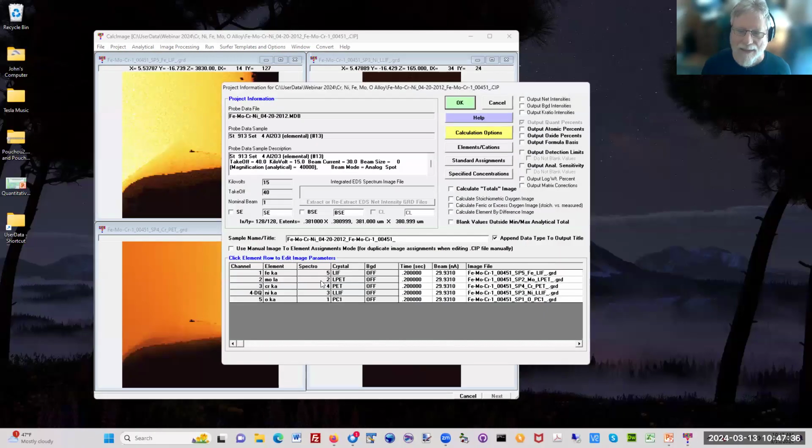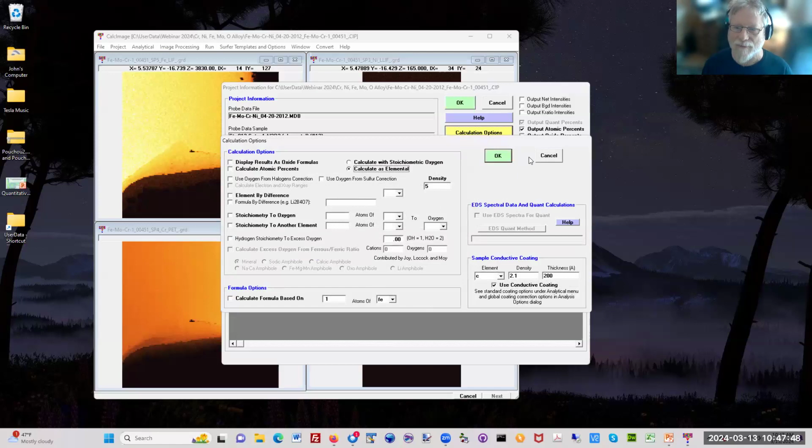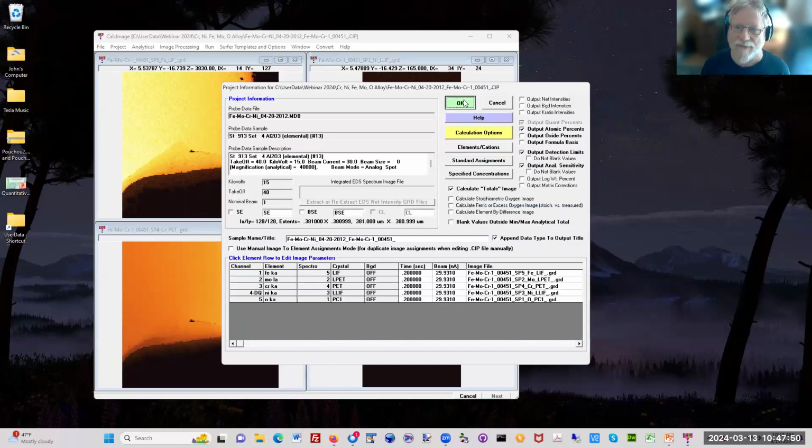And I can see that it's already assigned the maps automatically. I can do a totals map. I can do detection limits, analytical sensitivity, atomic percents, whatever I want to do. You get a lot of the calculation options you have in Probe for EPMA. So there's lots of different things you can do here.